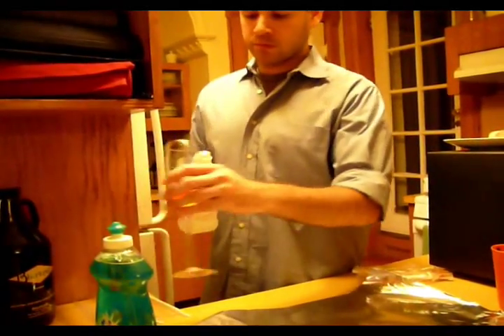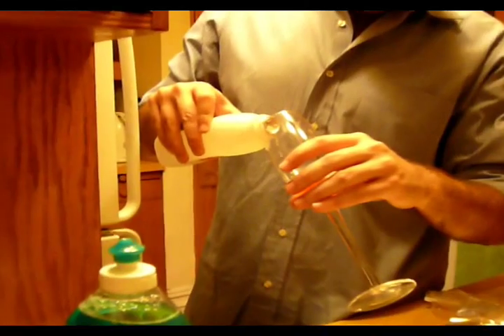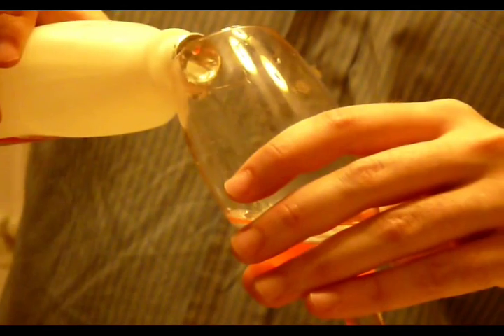Like layering a drink, right down the side of the glass. Stuff is definitely happening in there. See that? It's like bubbling up or something. You see the white stuff in between. Yeah. That is nuts.